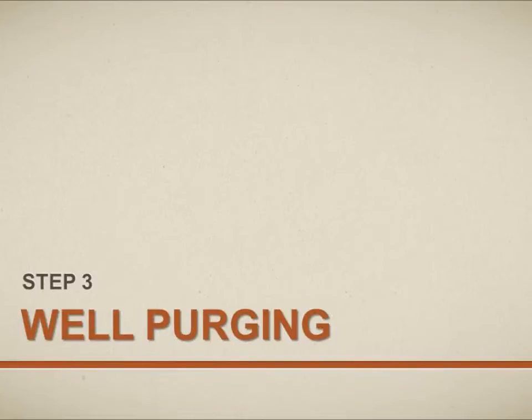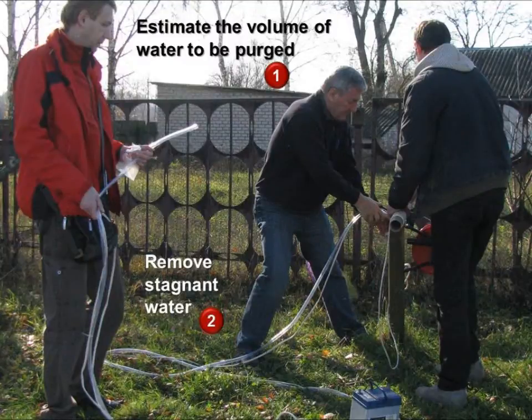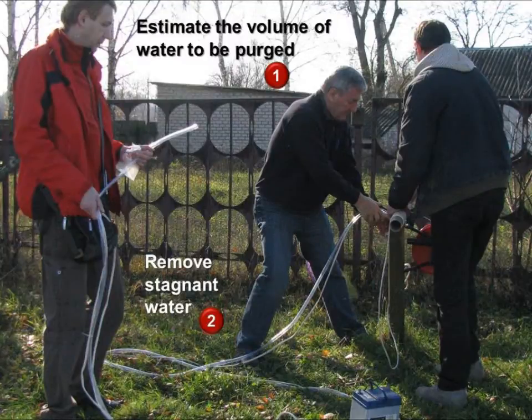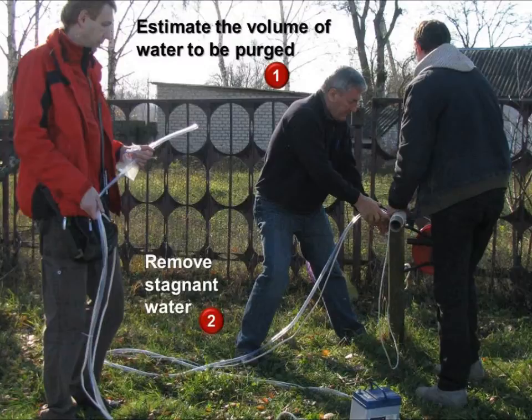Step 3: well purging. Stagnant water, which is water that has been sitting in the well casing, is quite different, both physically and chemically, from aquifer water. It is therefore necessary to purge this stagnant water before a representative sample can be obtained. Well purging introduces fresh groundwater into the well, which is representative of the samples you want to take. The amount of water to be pumped prior to collecting samples depends on well depth and diameter, the water level, and sampling program requirements.